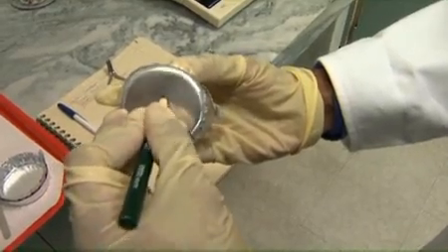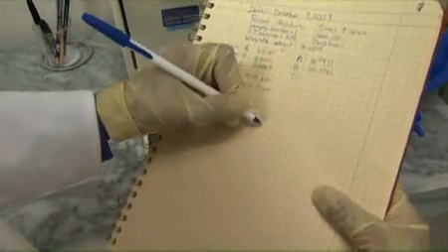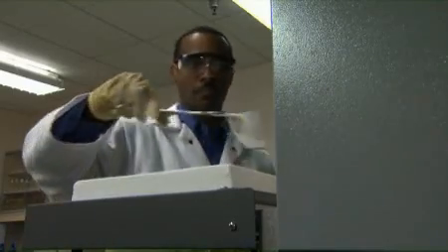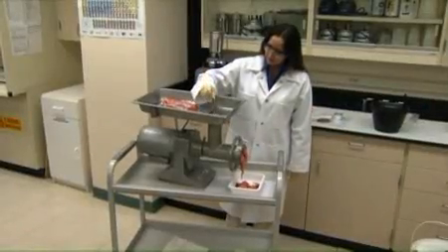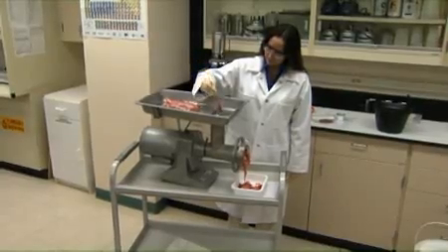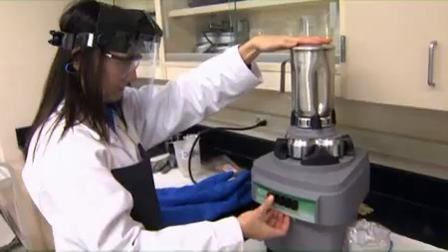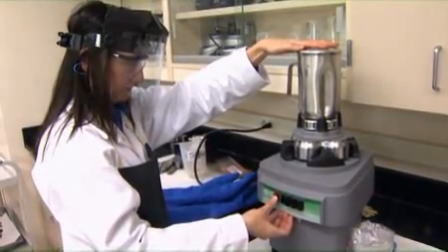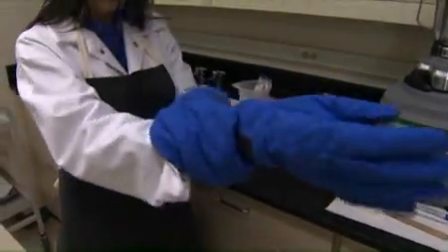Keep samples clearly labeled from preparation to disposal. Record observations at the time they are made. Exercise safety precautions at all times by using the specific safety supplies listed in the method. Additionally, exercise caution when working with industrial grinders and blenders as well as with knives and liquid nitrogen. It is advisable to wear safety glasses or a face shield to protect your eyes from debris or chemicals. Cut-proof gloves to protect your hands when cutting. And a lab coat and laboratory apron as well as temperature-resistant gloves when working with liquid nitrogen.